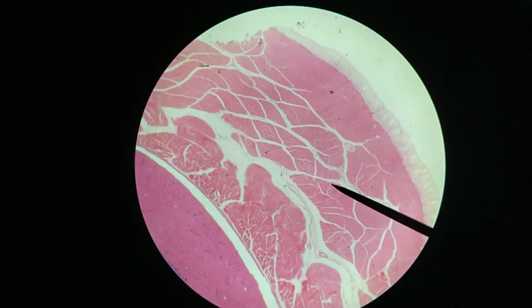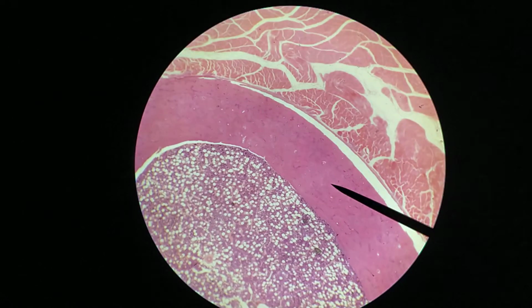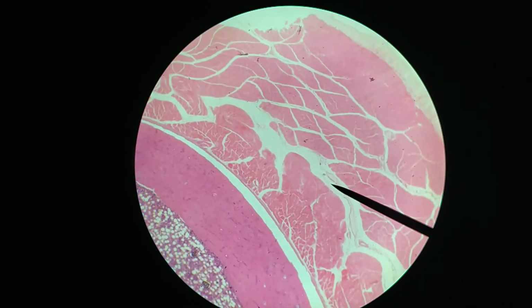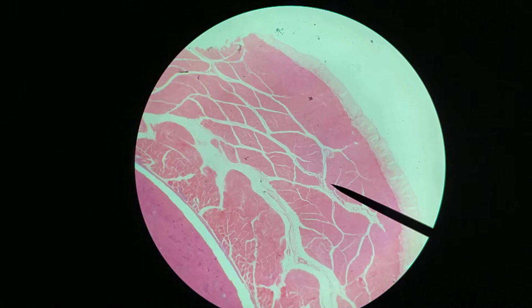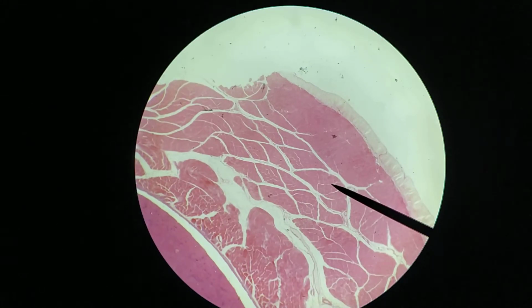Okay, so I've got the next slide queued up, so let's switch over to the 4x lens to get an overview of what we're looking at. So this is actually a bone slide, so we have a cross section through some bone here and some bone marrow, but we're going to focus on the outside of this, which contains the muscle. Even at this magnification, you're starting to notice a bit of an organization in cross section through the muscle where you see the fascicles. So let's take a closer look at these things so you can get a better view of what's going on.